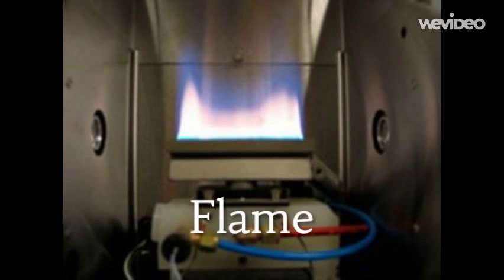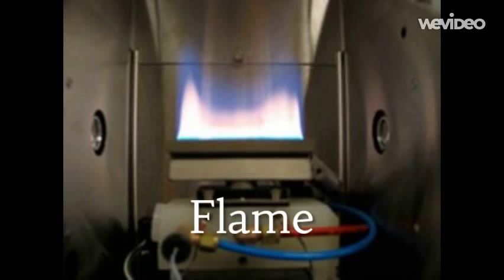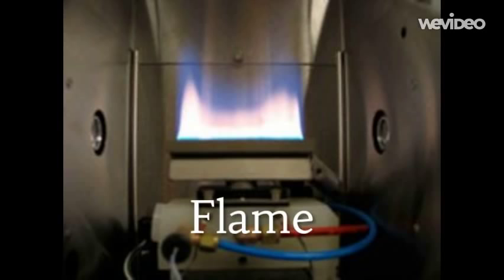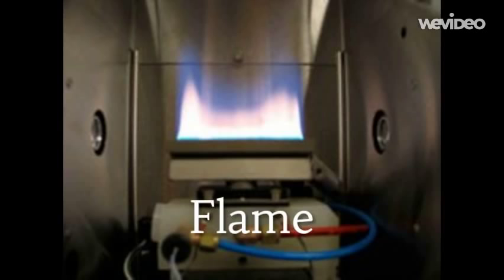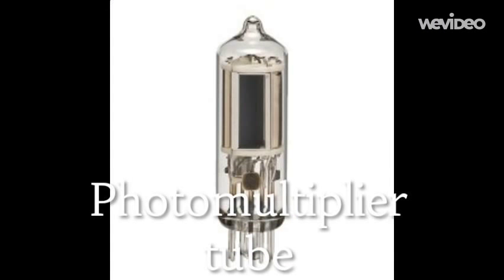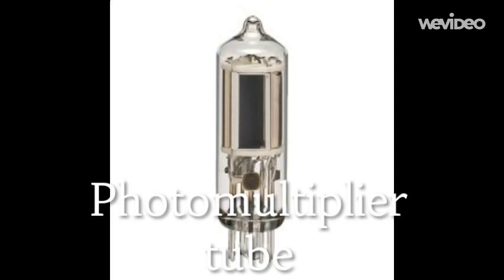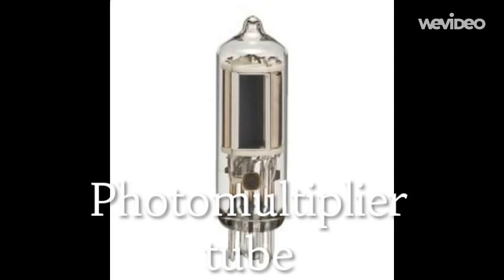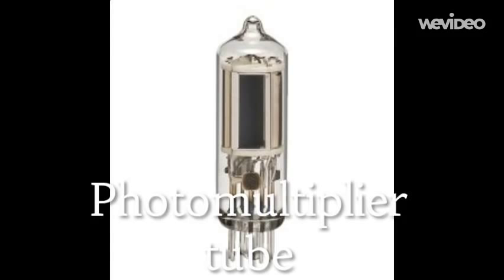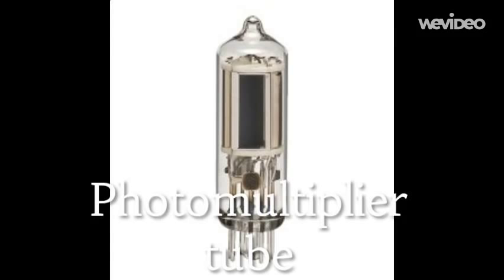The sample of interest is aspirated into the flame. Metals will absorb ultraviolet light in their elemental form when excited by heat as a result from the flame. The photomultiplier tube determines the intensity of photons of the analytical line exiting the monochromator, and is the most commonly used detector in AA spectroscopy.